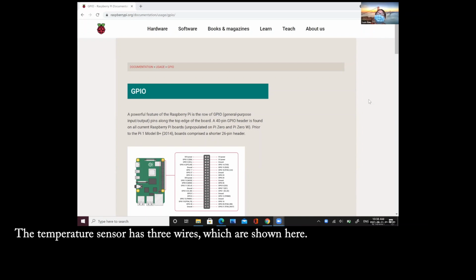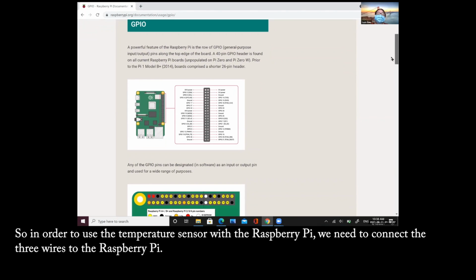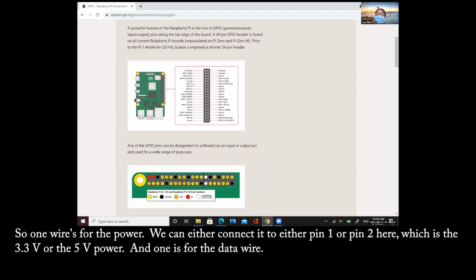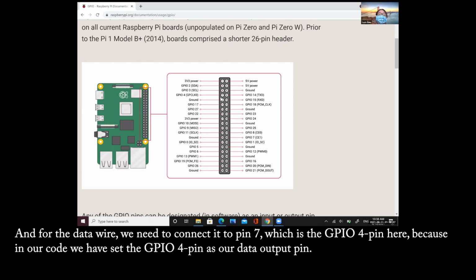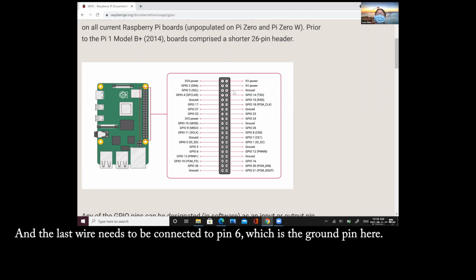The temperature sensor has 3 wires as shown here. So in order to use the temperature sensor with the Raspberry Pi, we need to connect the 3 wires to the Raspberry Pi. So one wire is for the power. We could either connect it to pin 1 or pin 2 here, which is the 3.3 volt or the 5 volt power. And one is for the data wire. And for the data wire, we need to connect it to pin 7, which is the GPIO4 pin here, because in our code we have set the GPIO4 pin as our data pin. And the last wire needs to be connected to pin 6, which is the ground pin here.